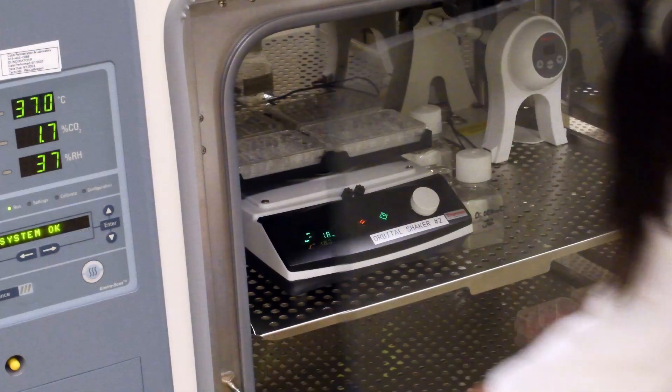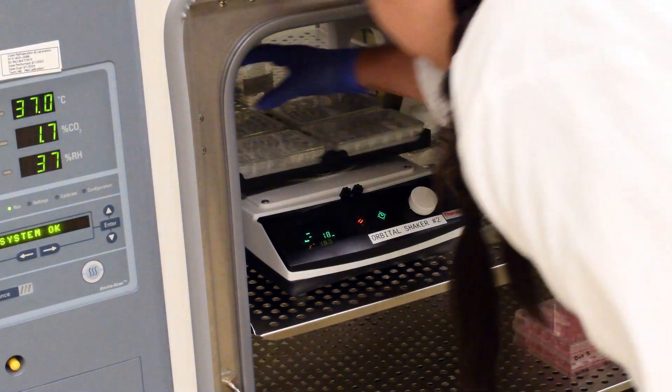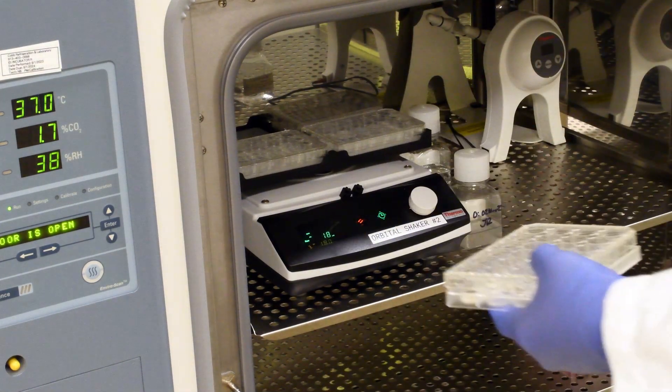Once the plates are loaded with cells, move those plates into a tissue culture incubator and rock at approximately 150 RPMs.